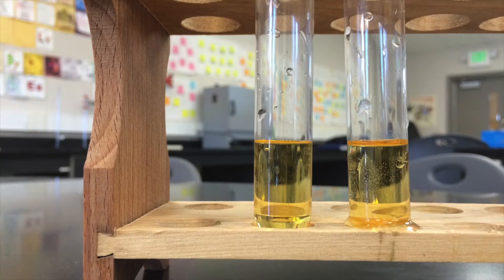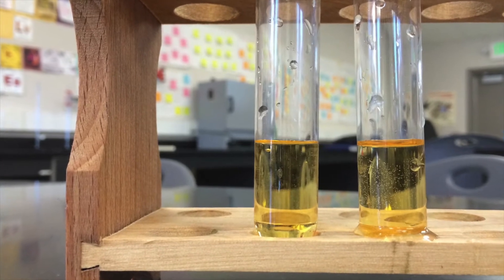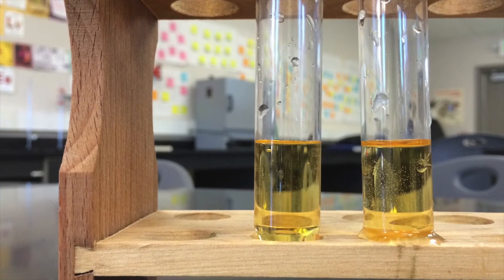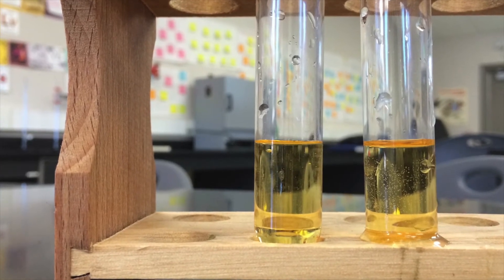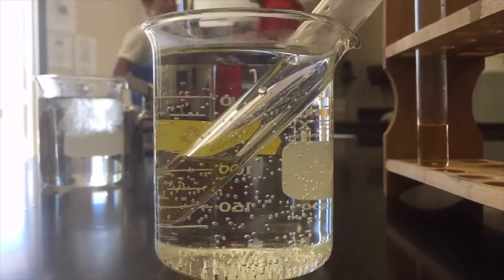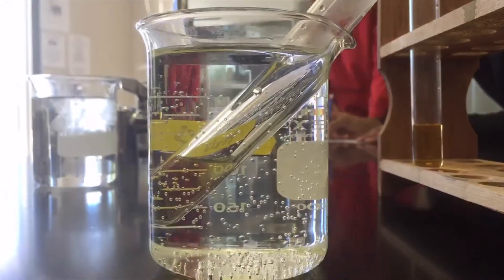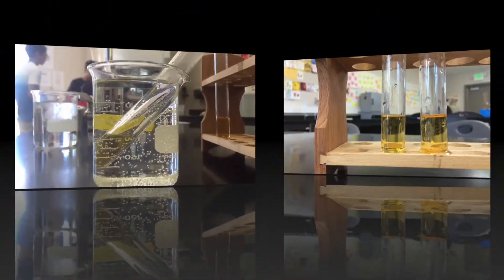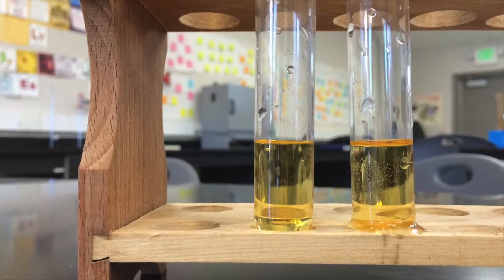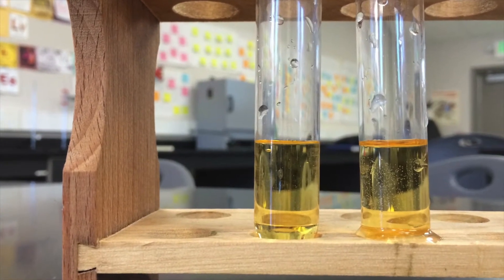First, we created two identical test tube solutions containing HCl, NaOH, and indicator. One will act as control. Next, we placed the experimental tube in a hot water bath of 70 degrees Celsius.